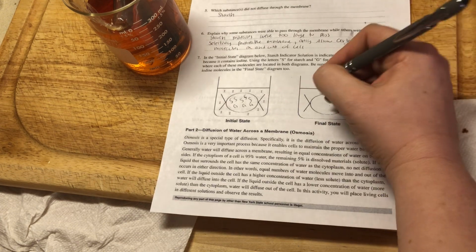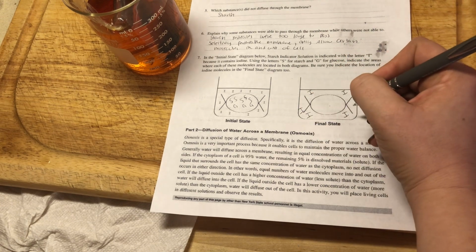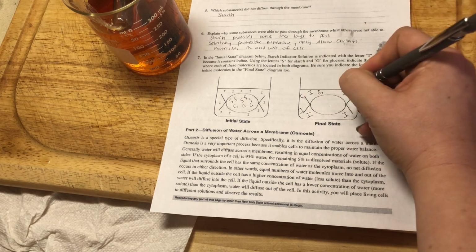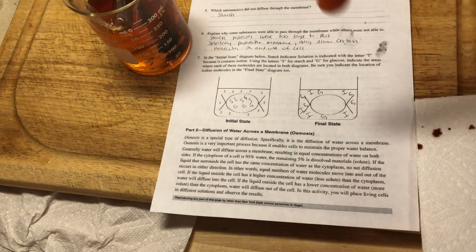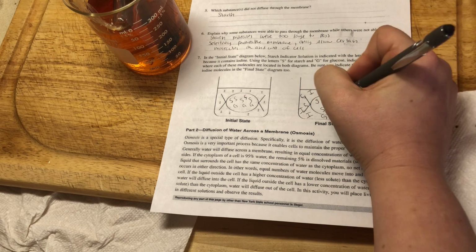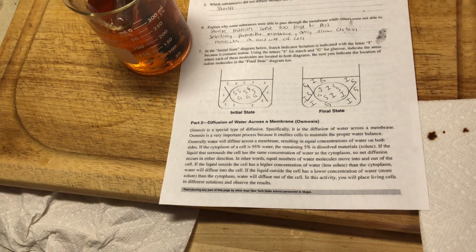Our final state, we had iodine still outside of the cell, right? We also had glucose outside of the cell, based off of our chemical indicator test of our beaker solution, right, that we did here with our orange solution. And then in here, we had starch and iodine, right? You can also put a couple G's in there as well, because I doubt all of the glucose left the cell. But for the most part, you should have starch and iodine in the cell and glucose and iodine outside of the cell in your final state, all right?